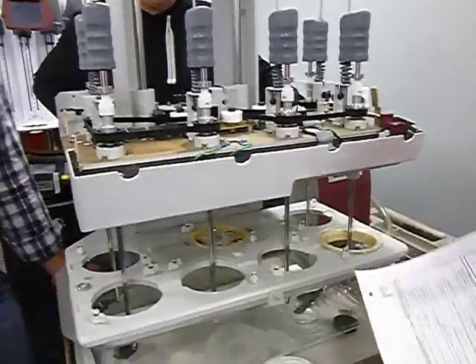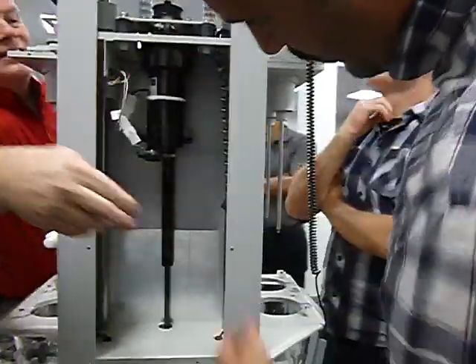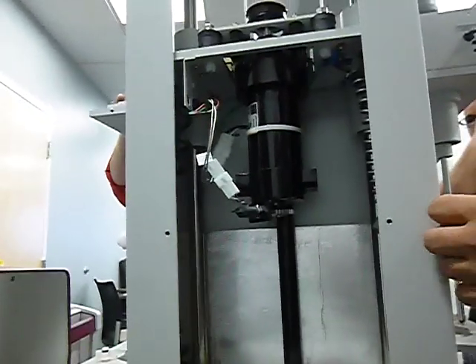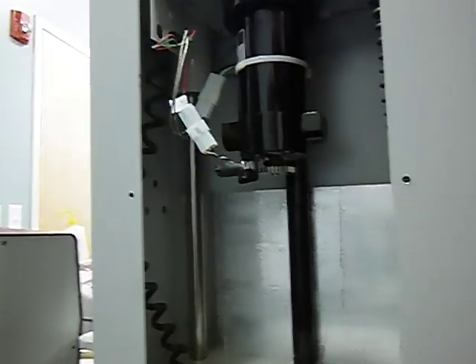Inspection of the hydraulic actuator. Hydraulic actuator is, if you come in the back here, this is your hydraulic actuator right in the middle. And the inspection of that really isn't a visual inspection. It's a feel. Functional. You need to make sure that it's functional. Functional means if I hit that brake there, it's doing its job there. Much like the hatchback of a car. It's holding it up.